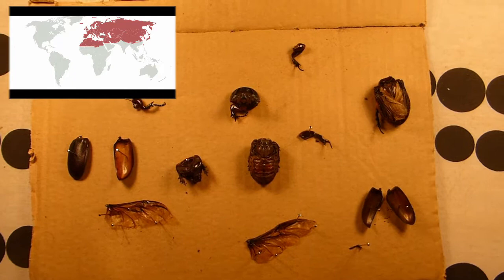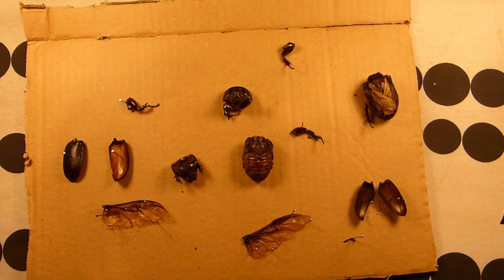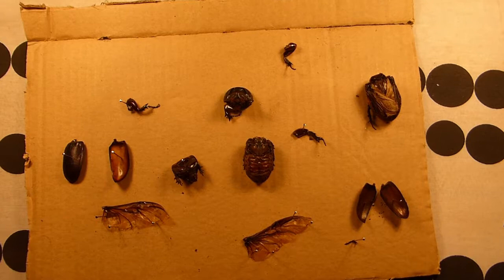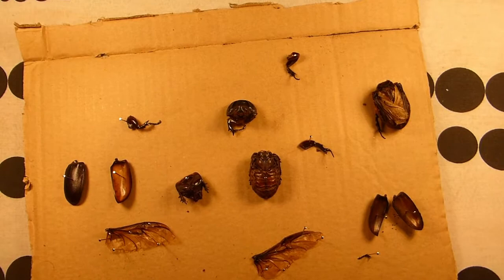These aren't native to the UK, but they are native to almost all of Europe and the Palearctic zone. These two individuals are two adult males. They have been dead for a few months. As I said, these beetles are fairly short-lived in adulthood. I had these for three to four months as adults and they have been dead for a fair while now, so they have desiccated.